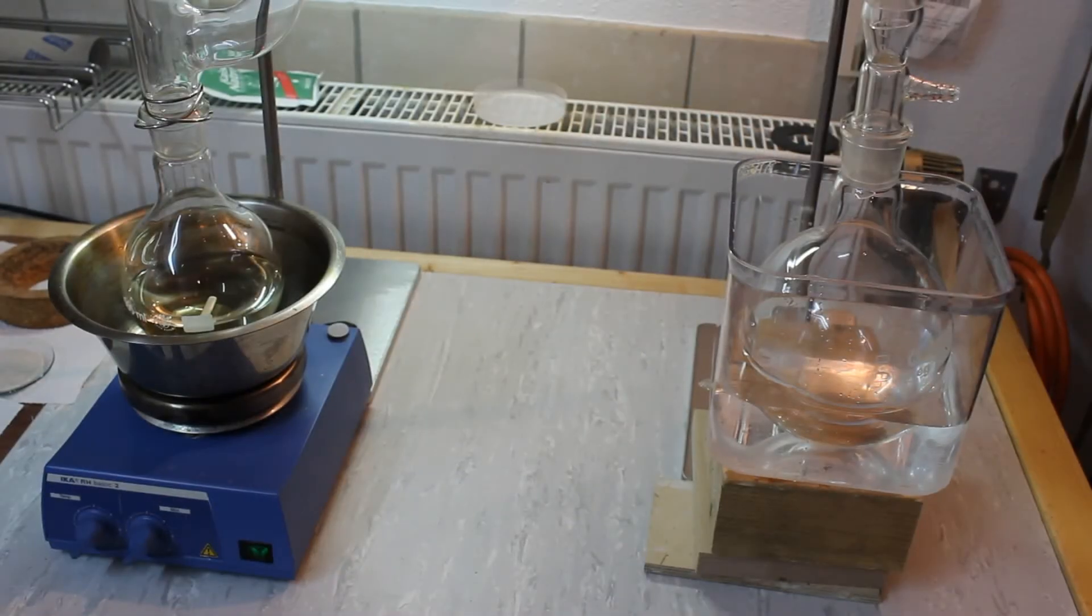Before we proceed it's time for a warning. Ether is very volatile and it readily forms explosive mixtures with air. So just take great care not to let any ether escape the apparatus. With that warning in place, let's continue.